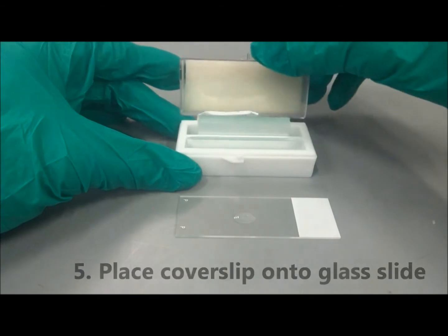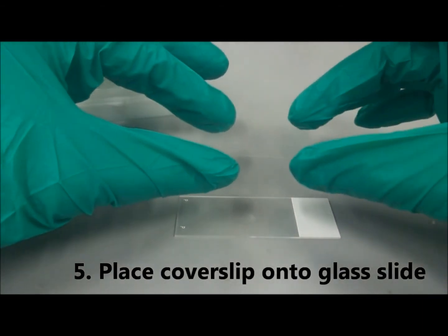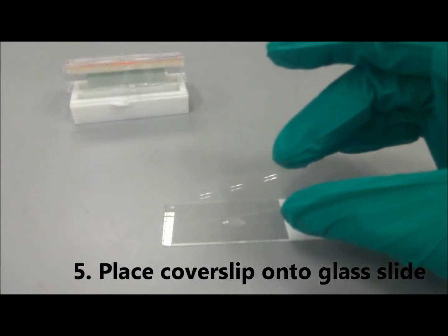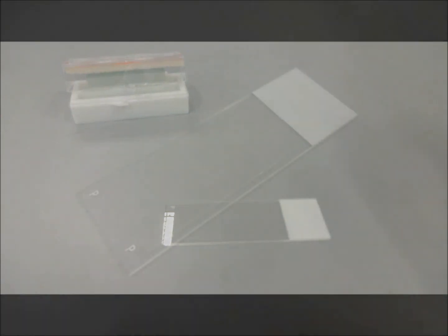Next, take a piece of cover slip and place it over the drop of solution. The liquid will spread out evenly on the slide and there is no need to apply pressure on the cover slip.